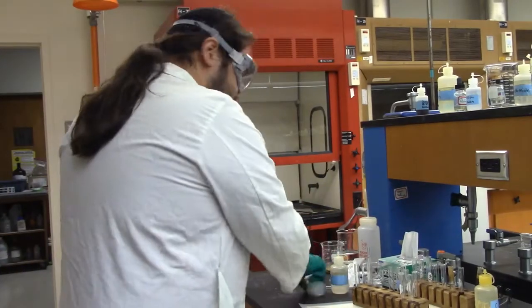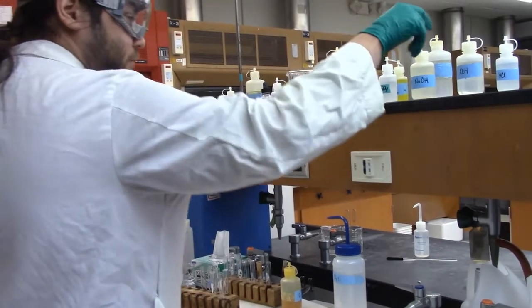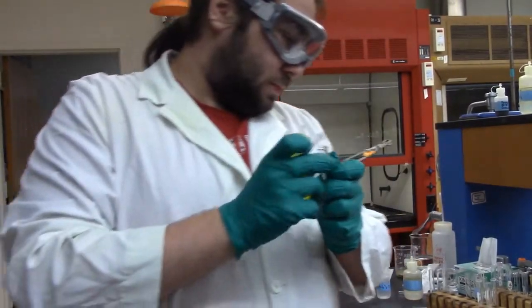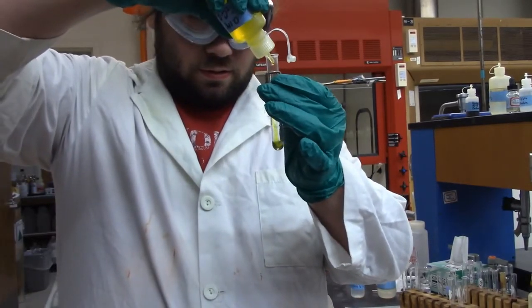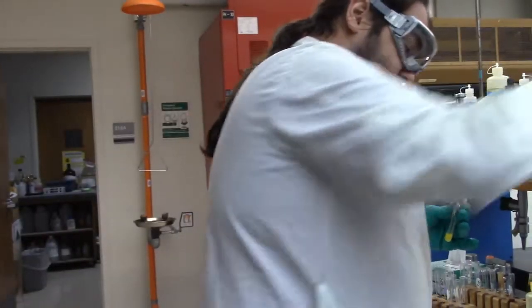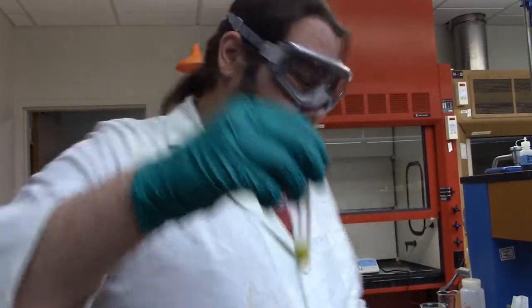And then I'm adding, what is it, potassium chromate? Yes, potassium chromate, which is up here somewhere. Here it is. So, how much is this? 10 drops. I'm going to add 10 drops of this. And we're going to heat it for a minute and centrifuge, and we'll come back to see if this yellow solution turns into something that we can call barium.